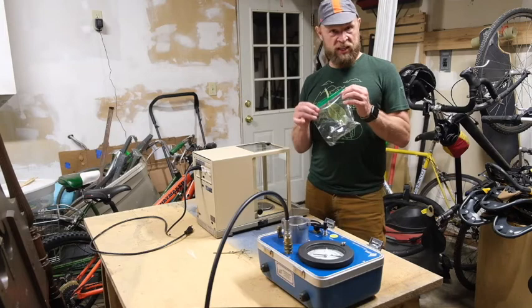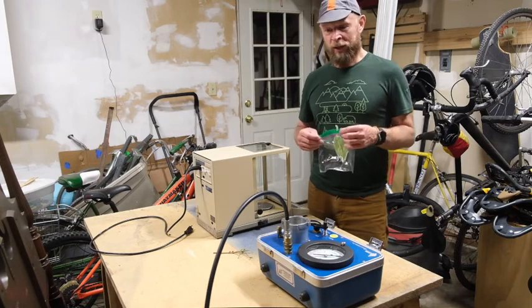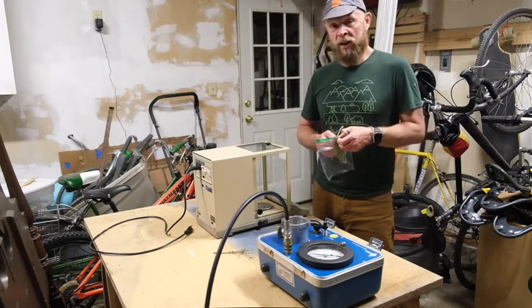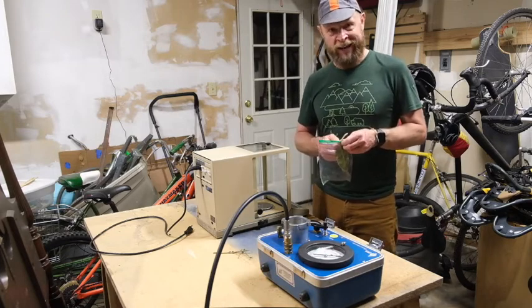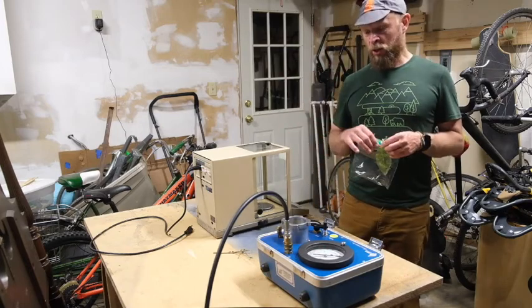Ideally, I want 15 to 20 measurements. A lot of times that doesn't happen. Sometimes your leaf breaks and you only get a partial curve. There's reasons why you might not get 15 measurements. 15 is probably the minimum. I like to have 15 to 20 to be really confident in the curve, but I've also done curves with more like 8 to 10 measurements if that's all I can get. So that's how you get the data for the pressure volume curves.